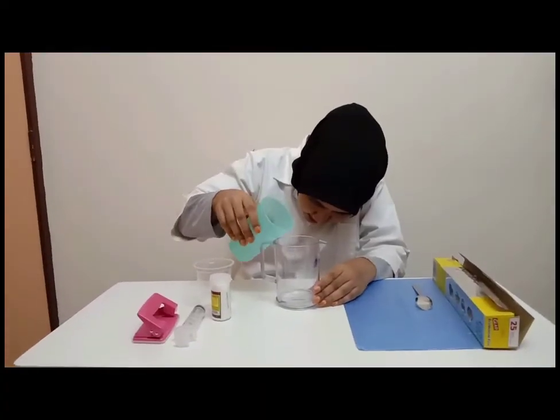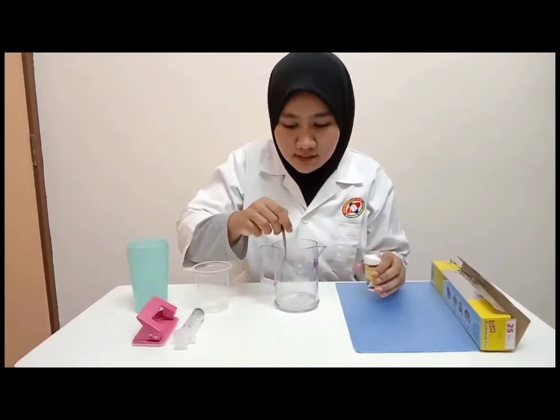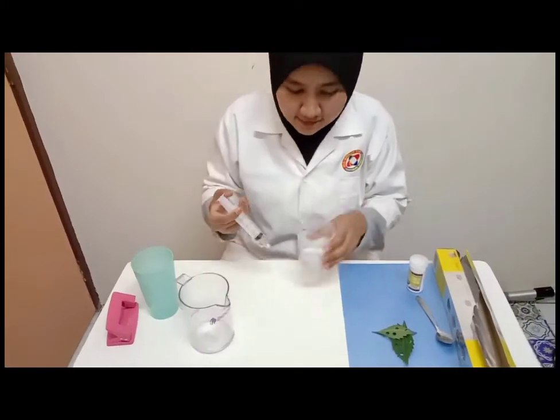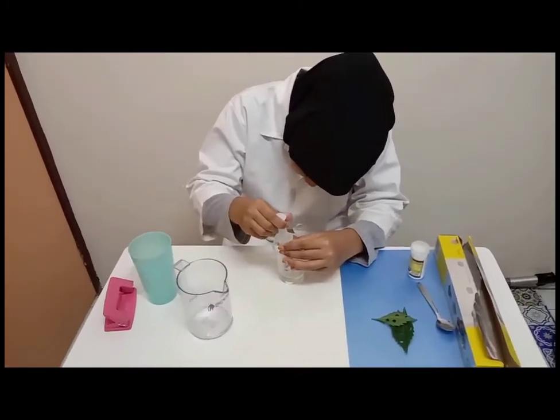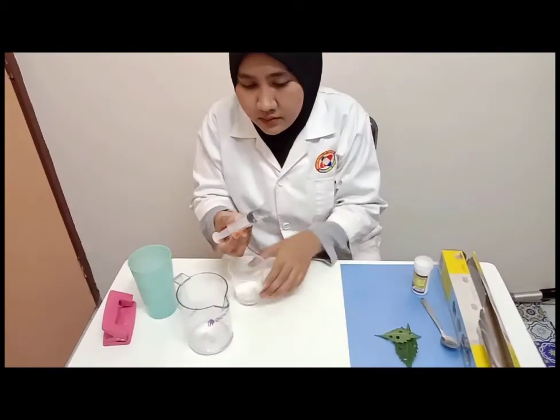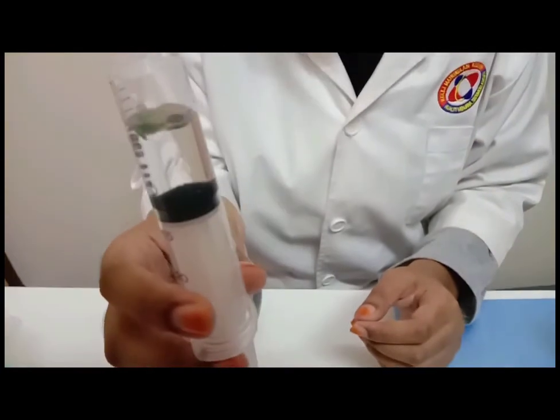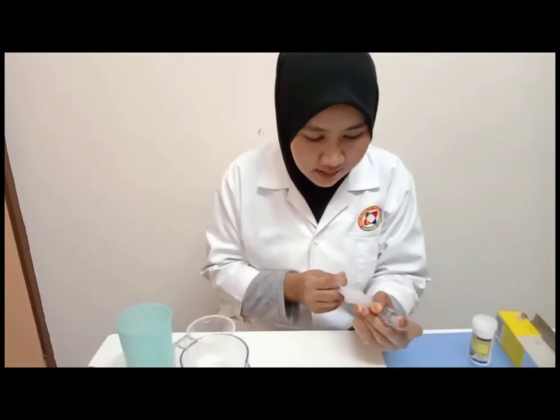In a 500 ml beaker, 0.5 grams of sodium bicarbonate is mixed with 50 ml of tap water. Then, about 6 to 8 ml of bicarbonate solution is drawn into the syringe. The leaf discs should float in the solution. Next, the syringe is held with the tip up and the air is expelled by gently pushing on the plunger.